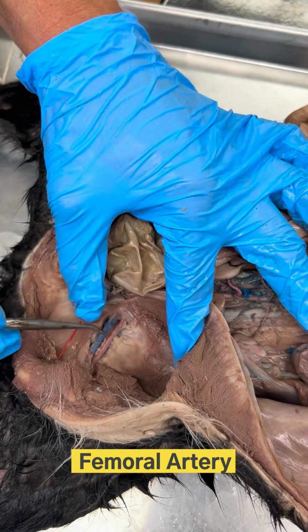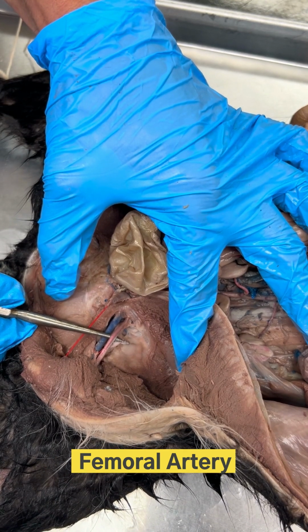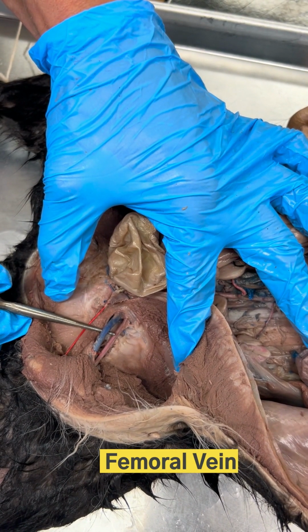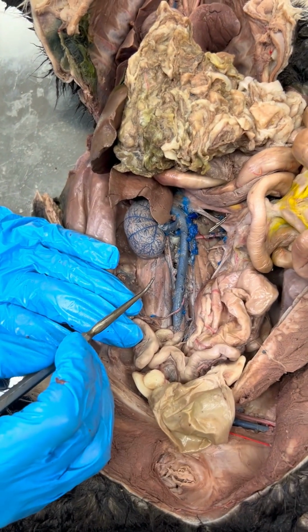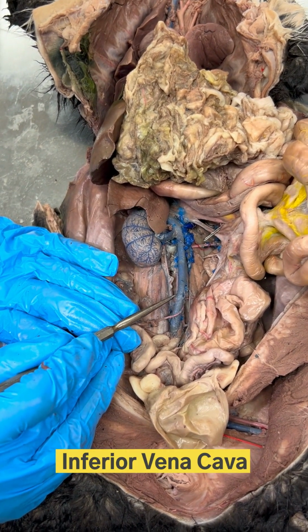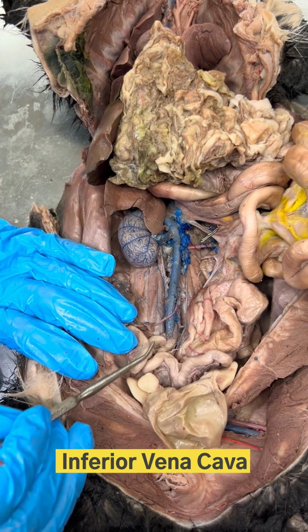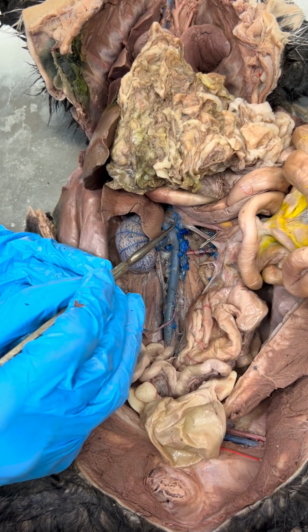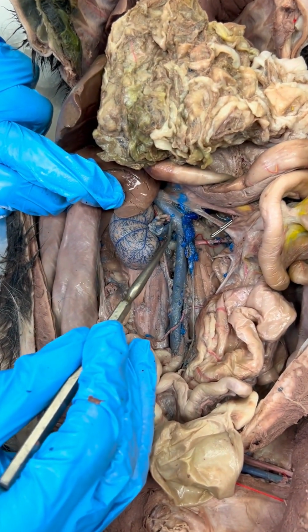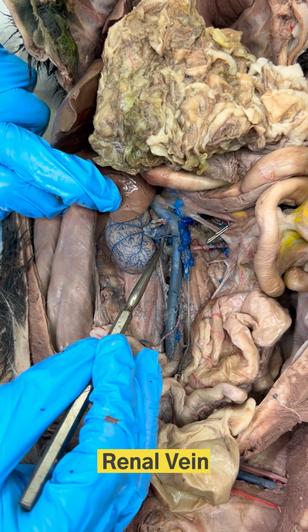When it does that, the name of this artery officially changes, and it is now the femoral artery, and therefore no surprise that the vein right next to it is the femoral vein. So focusing now on the veins of the abdominal cavity, the largest one we find right here is the inferior vena cava. It's going to take blood up toward the heart from beneath. Here we see a kidney, and so this vein right here draining from the kidney into that inferior vena cava is a renal vein.